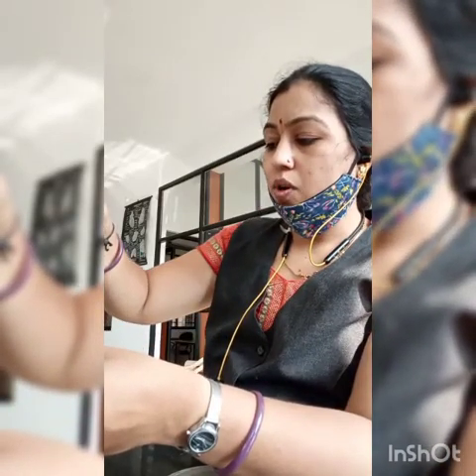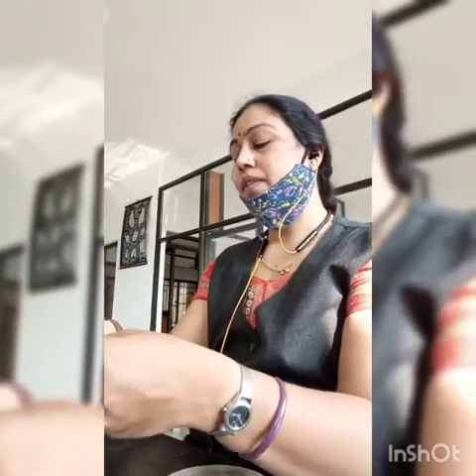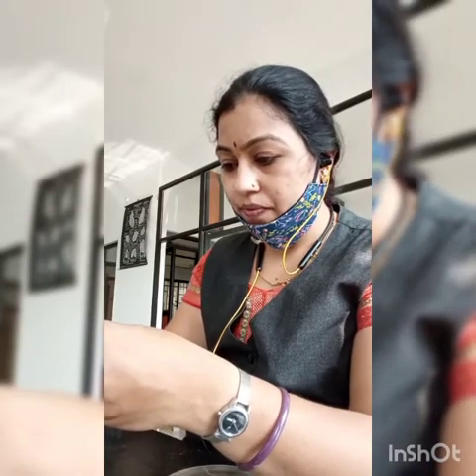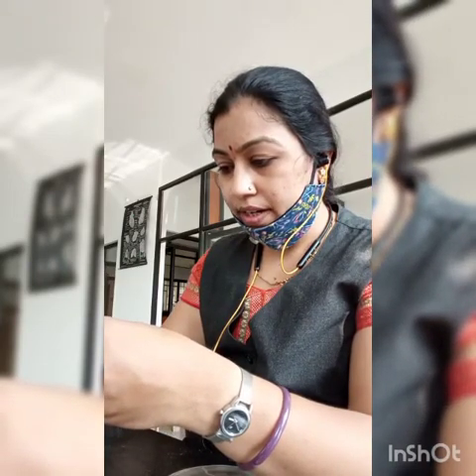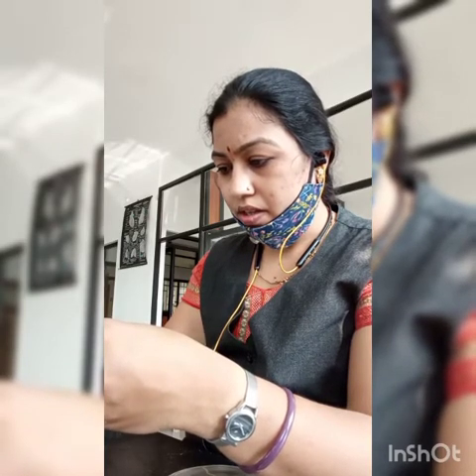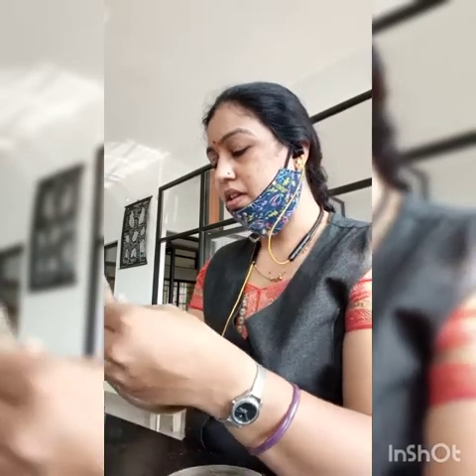So first sterilize the nichrome wire loop very well, then take a colony from this. So I will take the colony. So one colony is there. It's too hot.